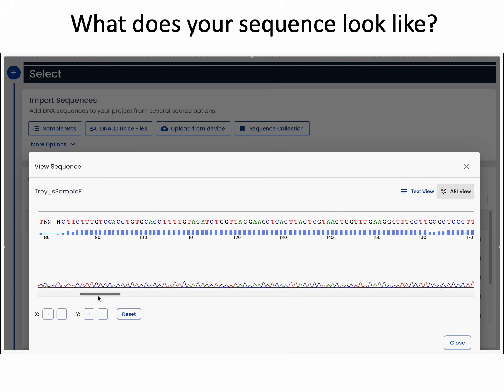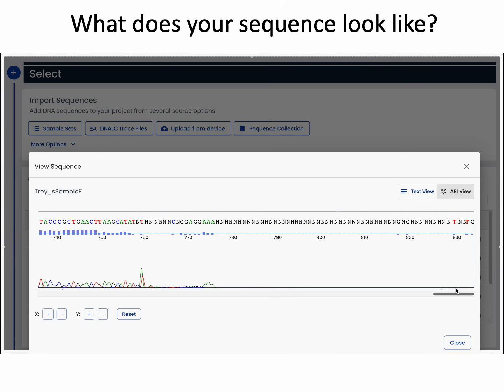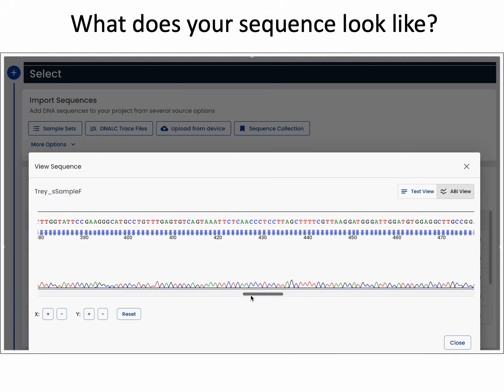You can also see the position of each of those base calls, or a count of each of those base calls. And you can scroll across and you can see that at the far ends, there's typically a bunch of Ns with very low bars or Phred scores, not surpassing the threshold for high quality. Whereas in the middle, you see most of those calls have clean and high Phred scores.